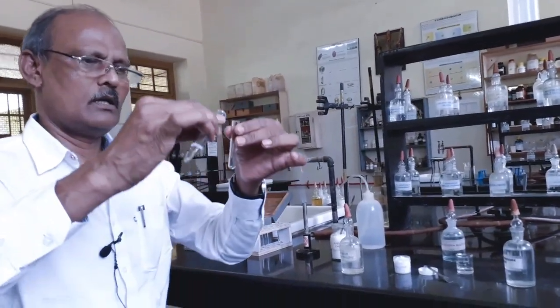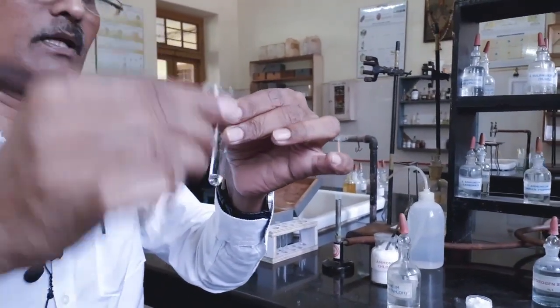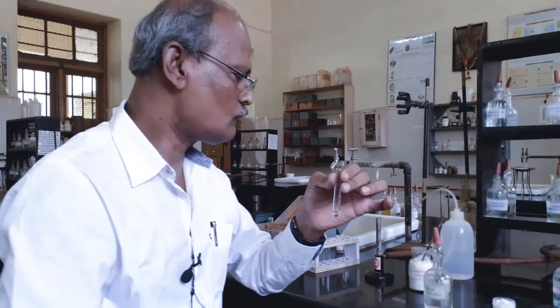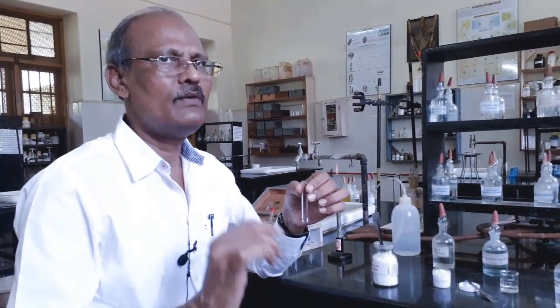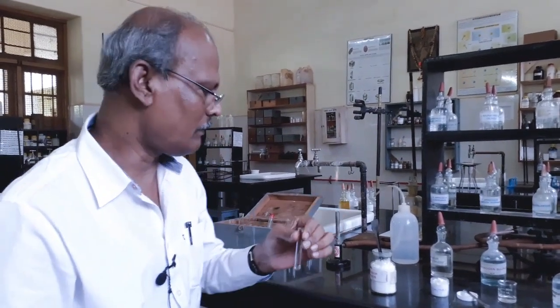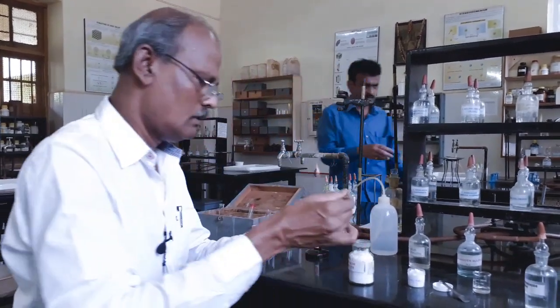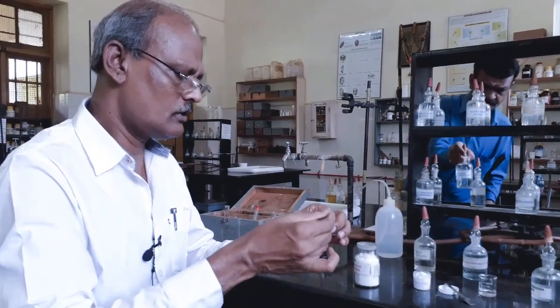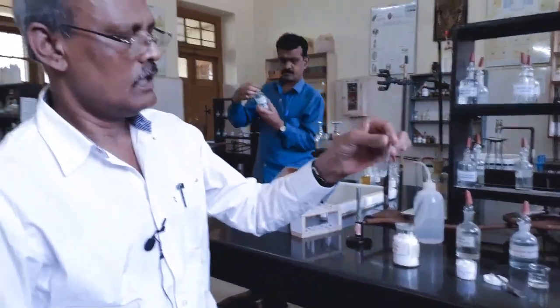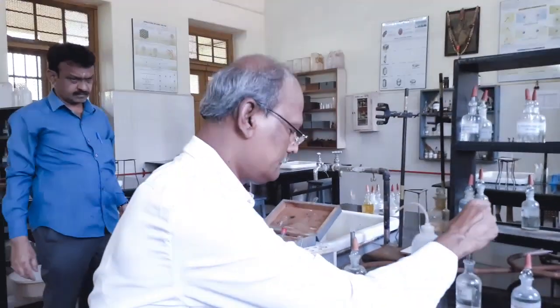I take about 5 drops, 1 ml of centrifugate in a test tube, and to this I am going to add the required reagents for magnesium. Magnesium belongs to sixth group. We have only one test to show the presence of magnesium and also to confirm the magnesium. The reagents are ammonium chloride. I am adding solid ammonium chloride to the centrifugate and I dissolve. After dissolving, we have to add ammonium hydroxide.